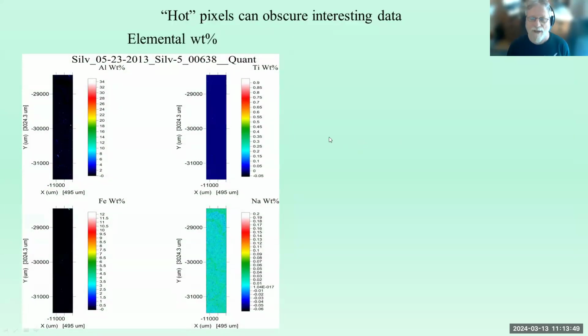Hot pixels can really obscure data. So here's an example of some maps on quartz that I did for Australian National University a while back before they had their Probe for EPMA software. And you can see the hot pixel right here. You see that pixel right there, and there's some pixels right there. Here's a hot pixel here. There's a hot pixel there, here, there, everywhere.